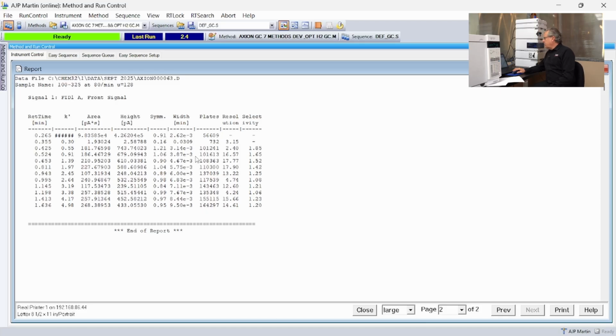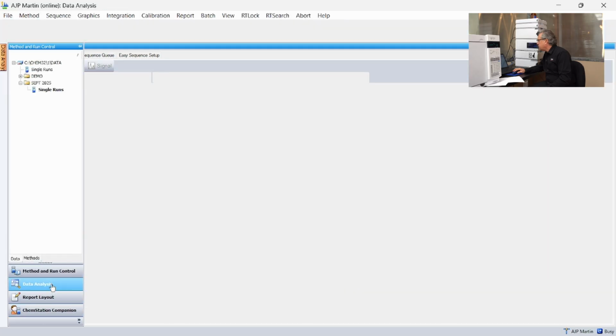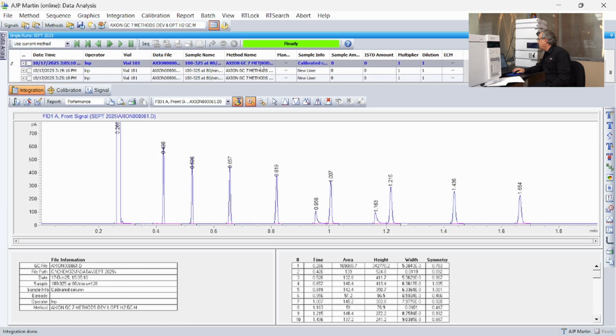So this is the one that we just ran, and if you notice the symmetries, 1.0 is a perfect peak. So that's our solvent front. So we're up here at 1.06, 0.9, 1.0, 0.89, 0.98, 0.84, 0.99, 0.97, 0.95. The 2 worst ones are the 0.84 and the 0.89. Those are our alcohols. Now, let's see what they looked like before. So we're going to go over to data analysis, and we're going to go back to our calibrated column. I think this is the one we ran.